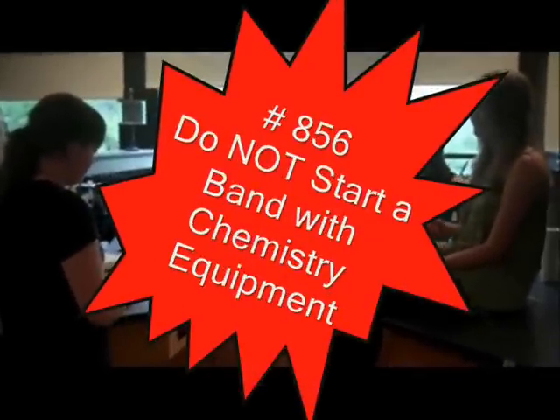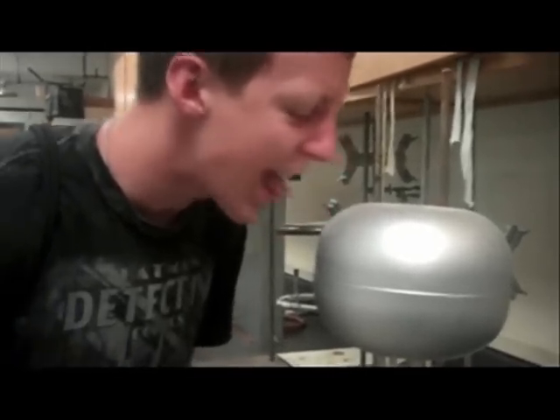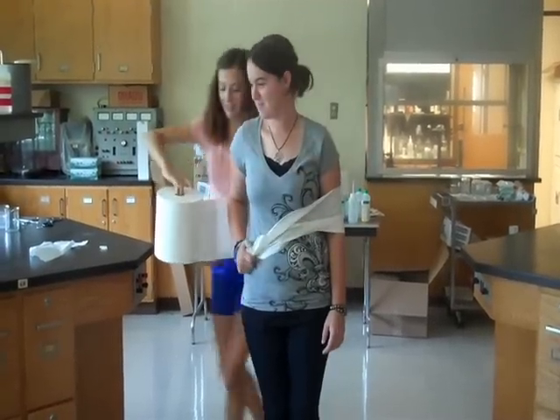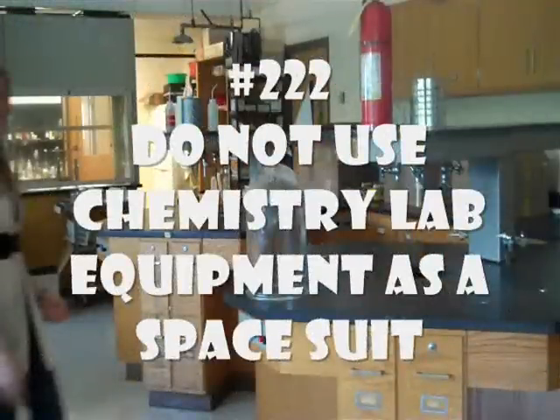Do not start a band using lab equipment. Rule number 665: this is not Halloween, so do not wrap your partner as a mummy. Rule number 222: chemistry lab equipment is not approved by NASA as a space suit.